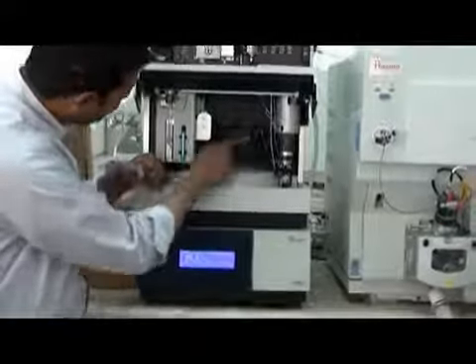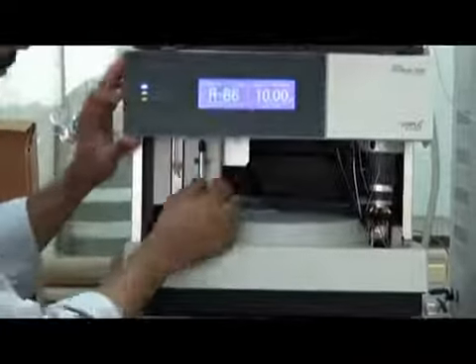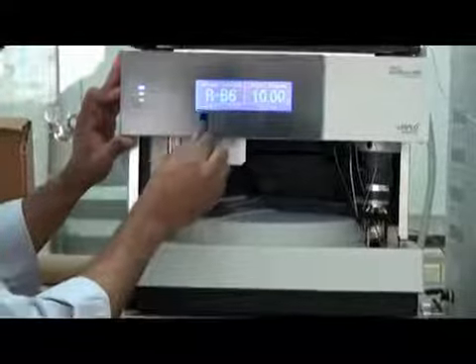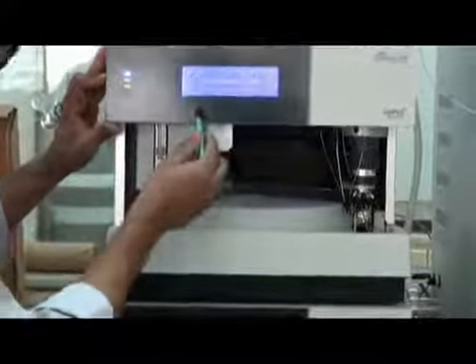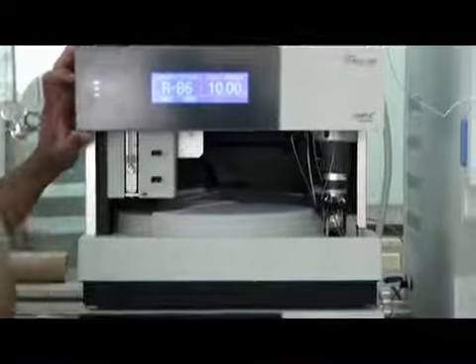This needle works along with your syringe. Here we have a syringe. This syringe is right now 100 microliters, and this is just a magnetic pen. If you want to clear something or make any adjustment from here, you can make it. This doesn't work like this. This works with this magnetic pen, like this.